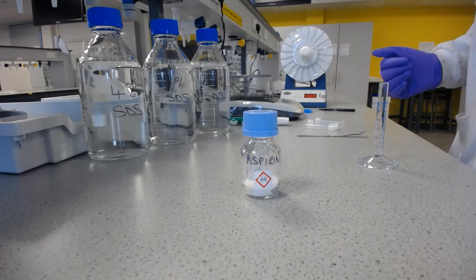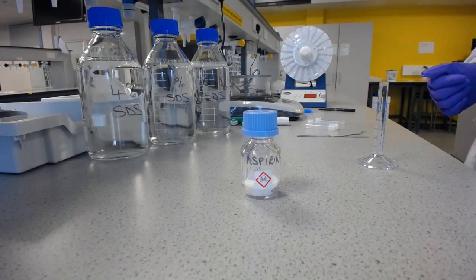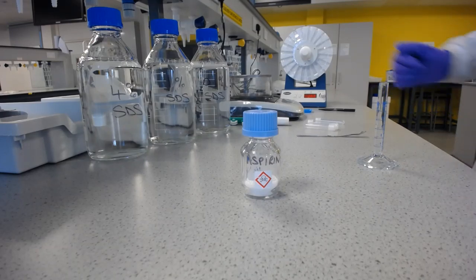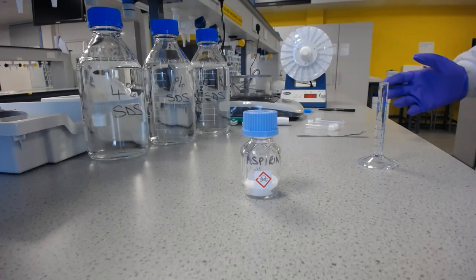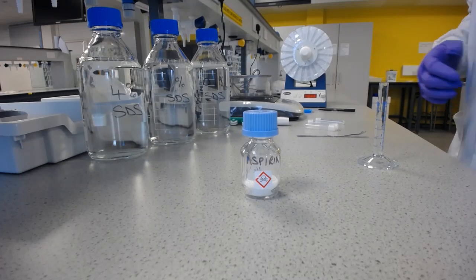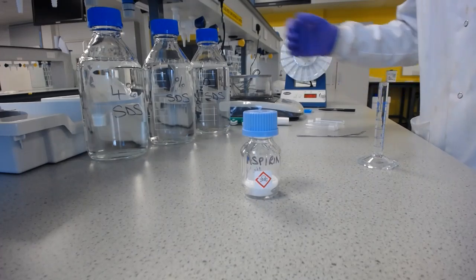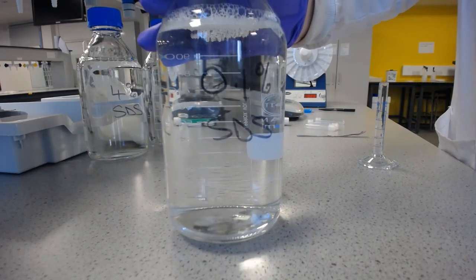It's in most washing up liquids, most shower gels, most laundry liquids, and so on. So most liquid detergents that you use at home will have sodium dodecyl sulfate in it. And you really don't need a high concentration to get past that critical micelle concentration. And a really easy way of telling if you're past the critical micelle concentration is to just look as to whether you're forming bubbles or not.